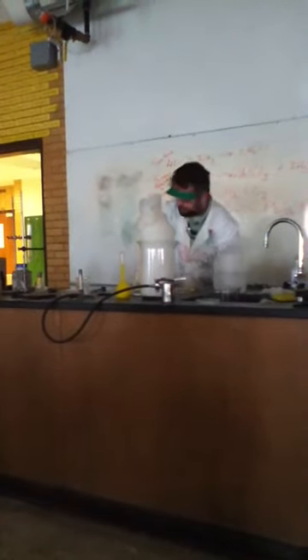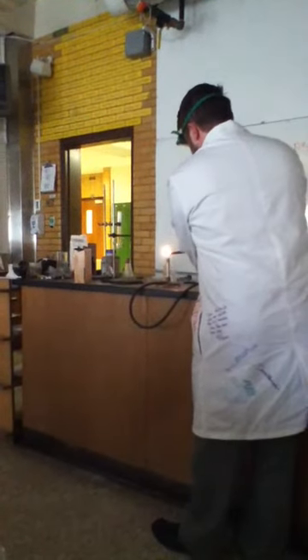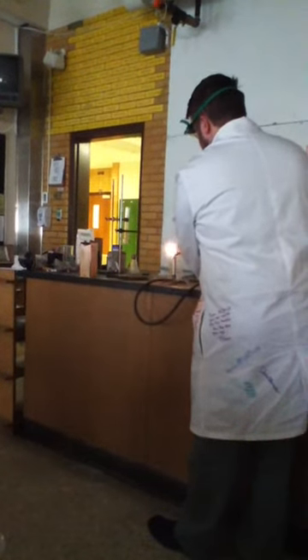Okay Angela, you're on camera now. We are going to demonstrate combustion by starting one combustion reaction. That's my Bunsen burner here. And I'm going to show you what 35 calories, or one tablespoon of corn flour, looks like.